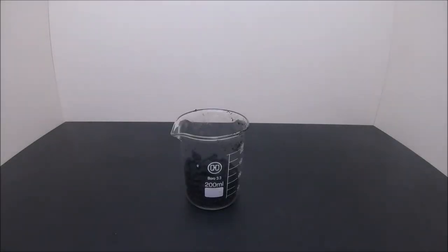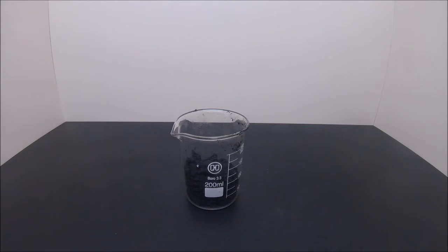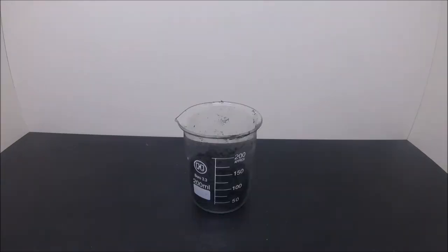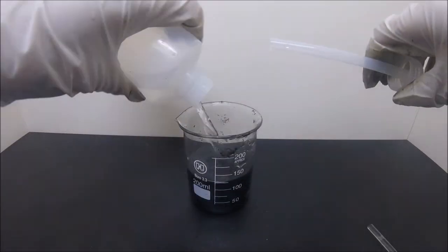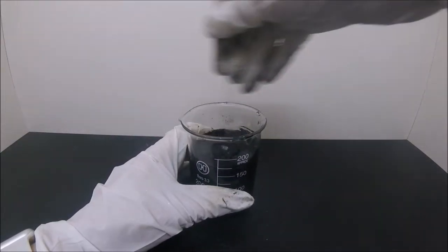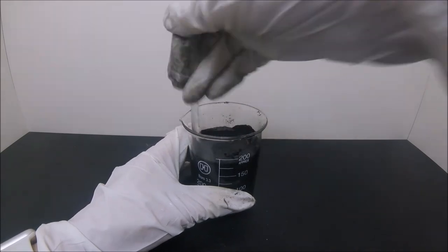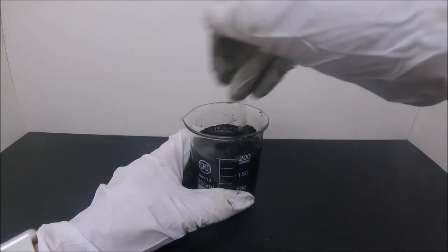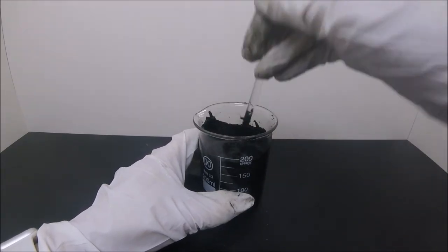Now we have the manganese dioxide with ammonium chloride contamination. To remove that, we will have to wash it. Since ammonium chloride is very water soluble, but the manganese dioxide is not. Now get some distilled water and mix it thoroughly.